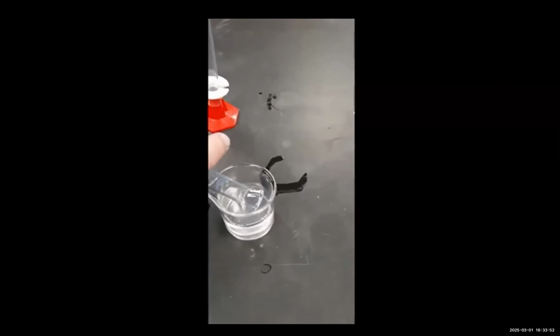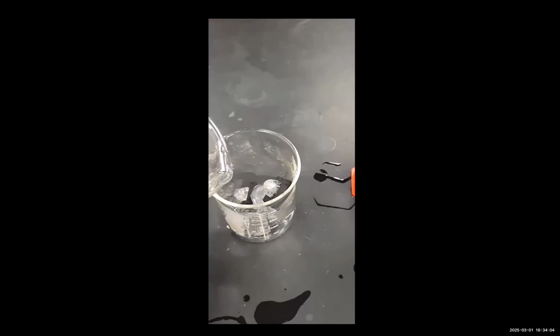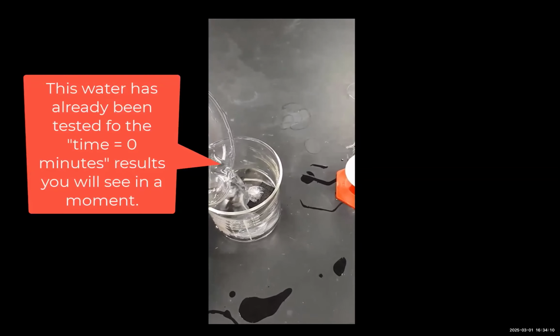In this first part, we're looking at the preparation of a solution. That solution was loaded into the dialysis bag. As you can see, that's the dialysis bag that's being filled. And the dialysis bag is now being immersed in deionized water.